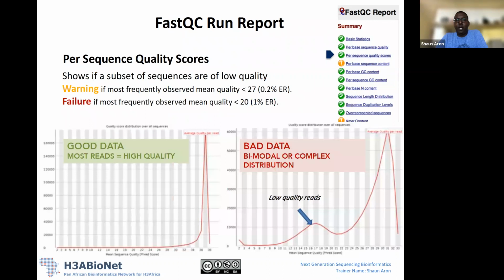The next metric that we have is per sequence quality scores. This is basically saying, for all your sequences, what is the average quality score that's been observed? On the left-hand side here, you have the number of reads, and at the bottom of the plot is the mean sequence quality. If you've got 40 base reads, it will calculate a mean quality score across those 40 bases. For each read, it's calculating a mean score, and then it's plotting the number of reads at a particular mean quality score.